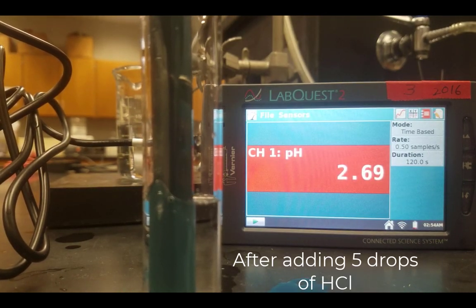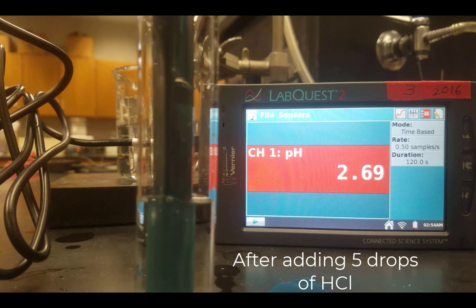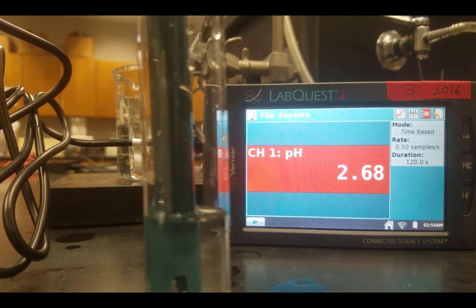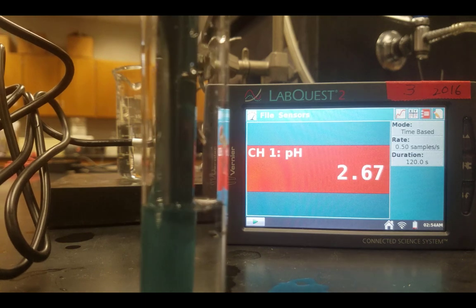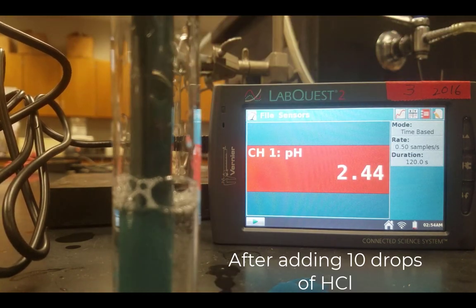and you'll see a note on the screen indicating that 5 drops of HCl have been added and that you should record the pH. And then I will add the next 5 drops of acid. And you'll see another note on the screen indicating that that is the value you should write down after 10 drops have been added.